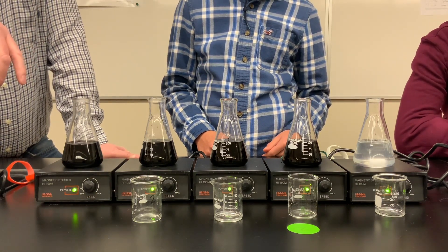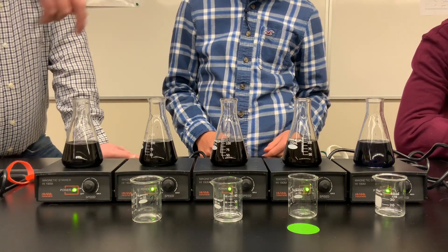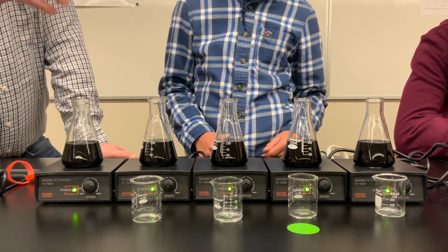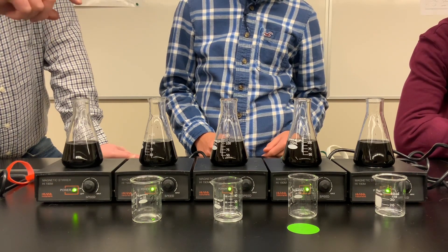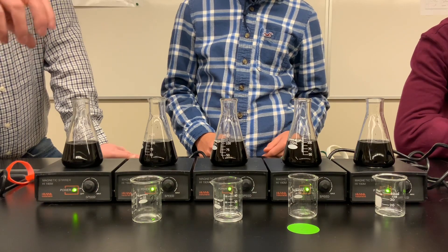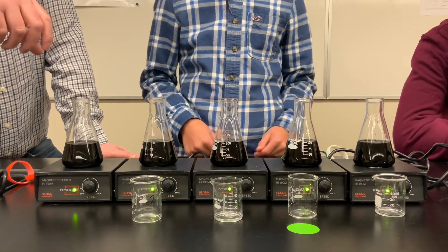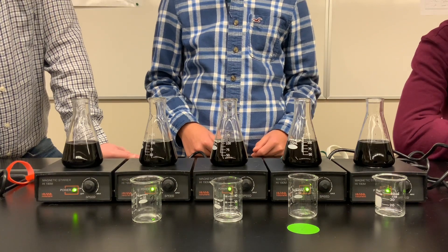We'll give it another 30 seconds or so. Sometimes that last trial is so dilute that it actually doesn't change color. Now you have enough information to calculate the average rate of reaction in each flask and the concentration of iodate in each flask. You can again graphically see the relationship between those two things, looking at the effect of changing concentration on the rate of the reaction.